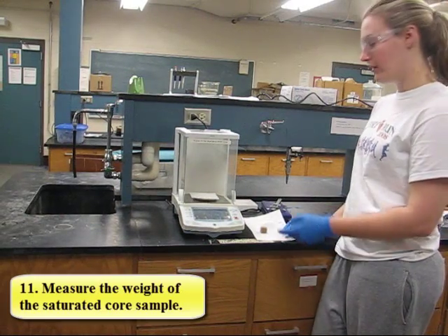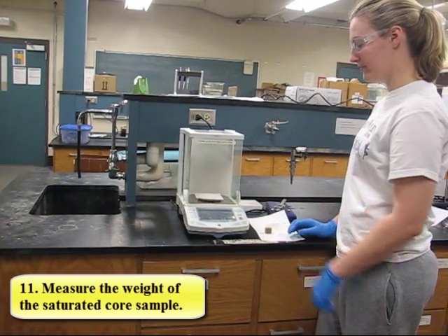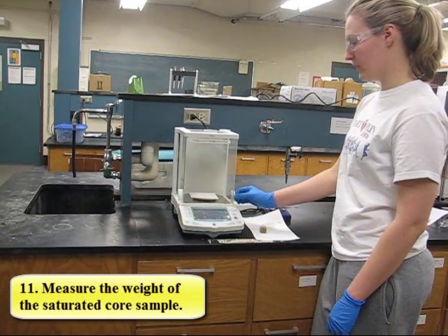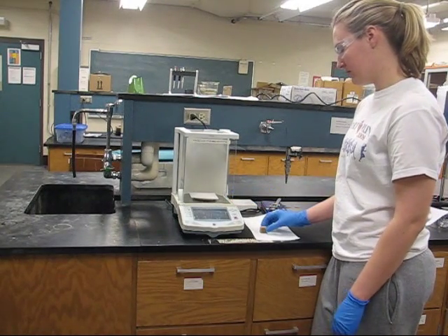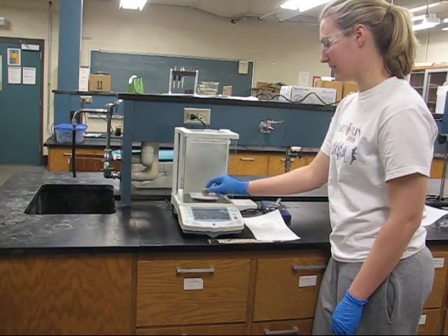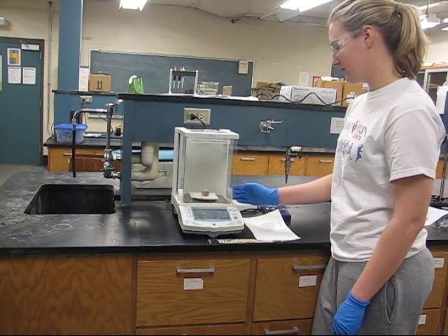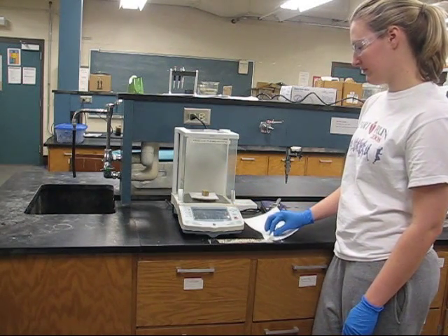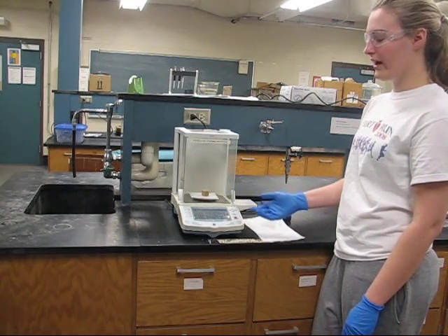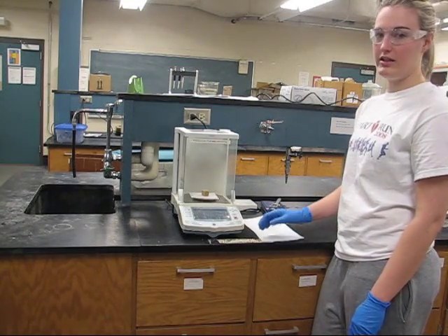We want to weigh it. First we're going to zero out our scale, open the sliding door, and place the saturated core sample on the scale. Record that reading and then measure the difference between the saturated and dry weights.